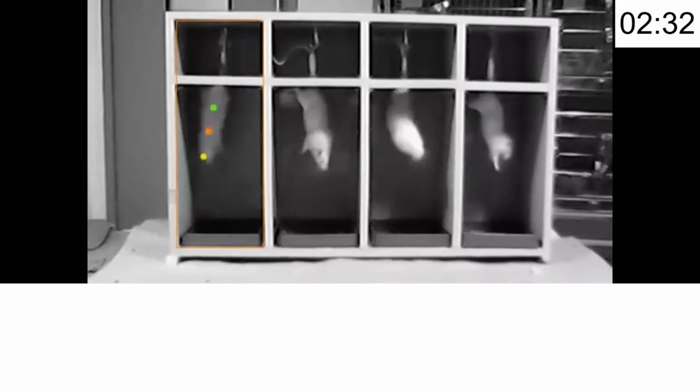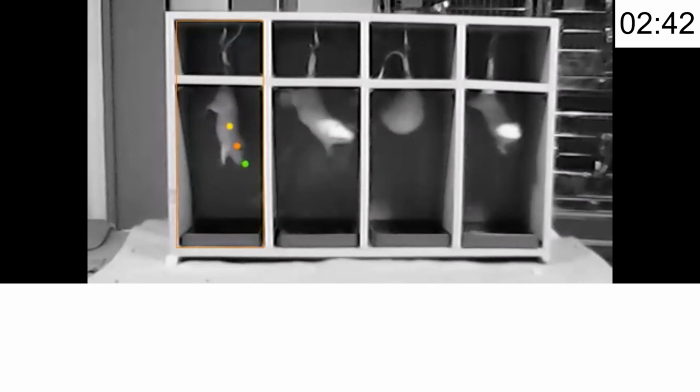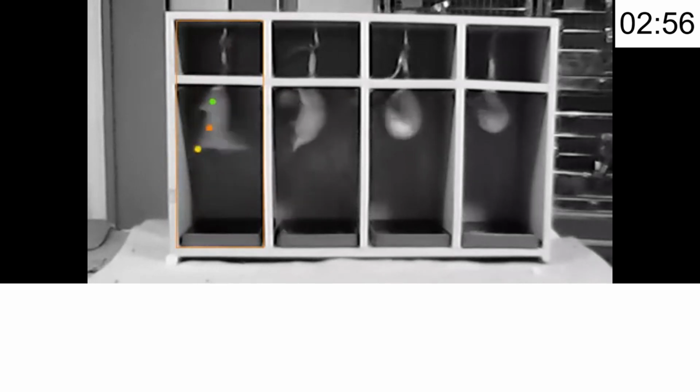Optional automation: modern setups may include cameras and software for automated tracking and precise data analysis. While the animals are immobile, you can see here it is showing the immobile period. So during that period it is already recording. For each and every animal in all compartments, by software you can easily track their immobile time out of 6 minutes.